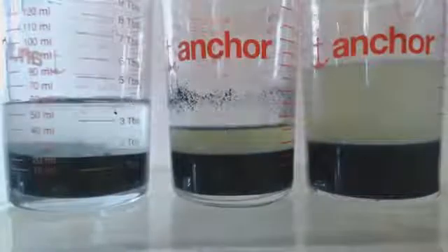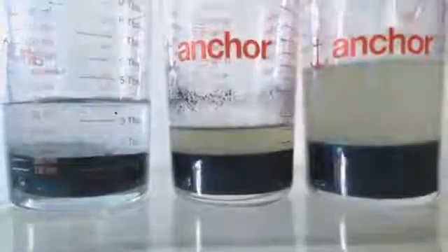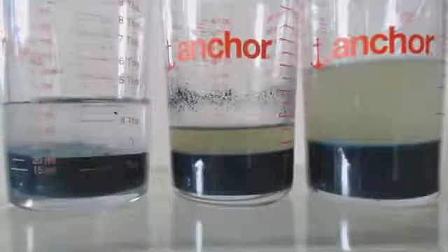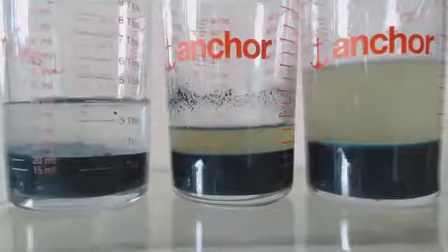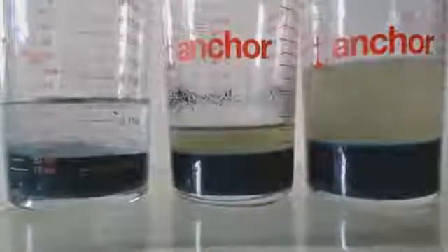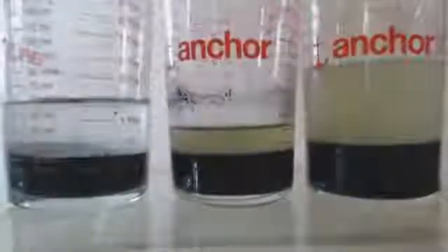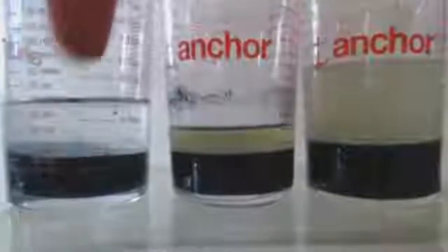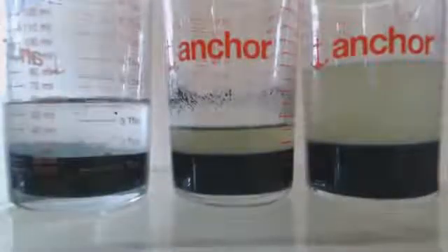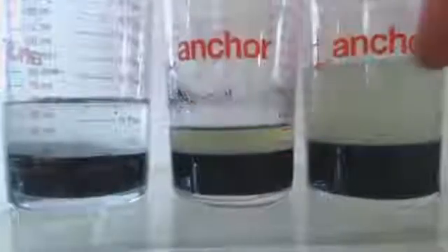You can see the top layer there where it's just water - all the precip is at the bottom. But at the top where it's liquid, you can see it's green. And that is the sodium chromium hexahydroxide coordination complex salt - that's the green brown khaki green. No matter how long you wait, it'll stay green because it's soluble.